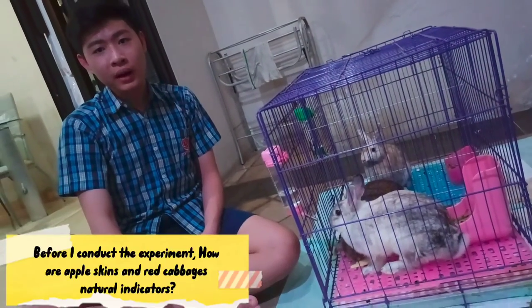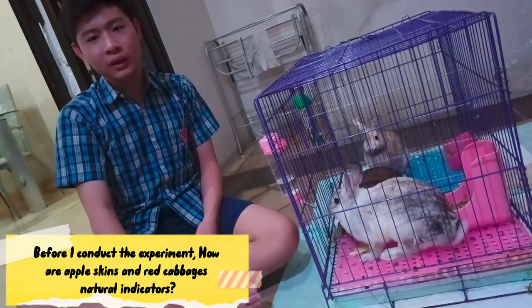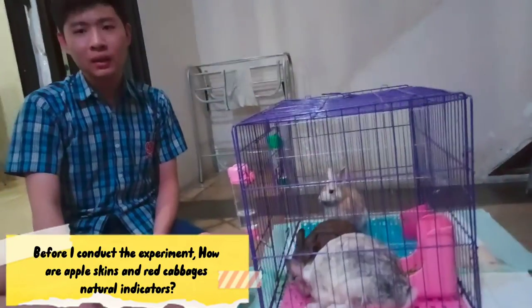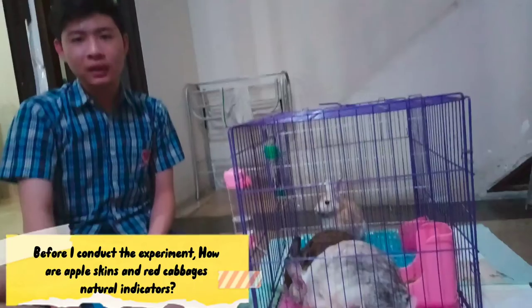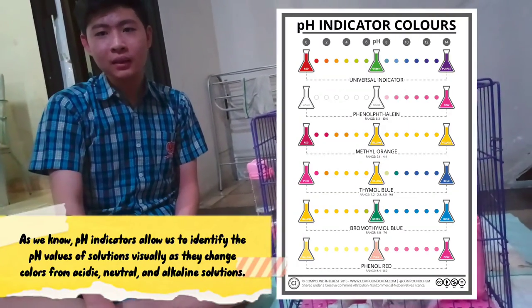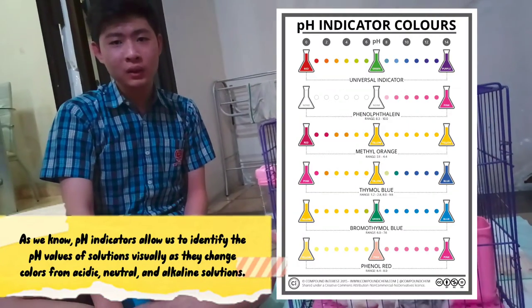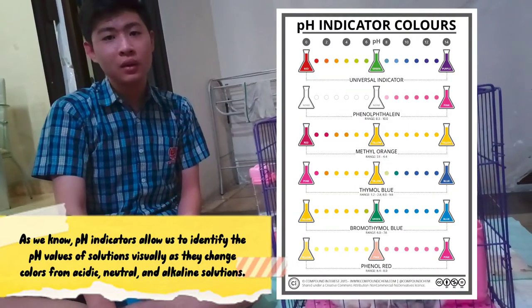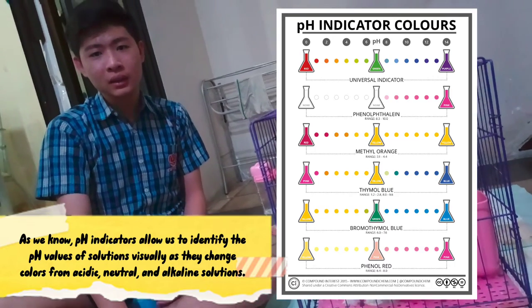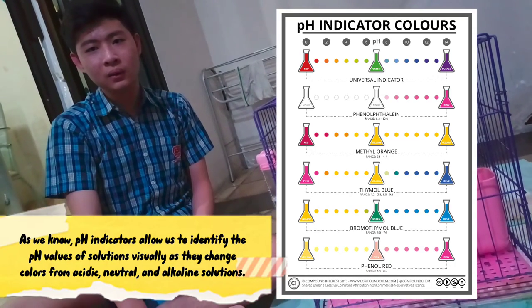Before I conduct the experiment, I'm going to give an explanation on why and how apple skins and red cabbages are natural indicators. As we know, pH indicators allow us to identify the pH values of solutions visually, as they change colors from acidic solutions, neutral solutions, and alkaline solutions.